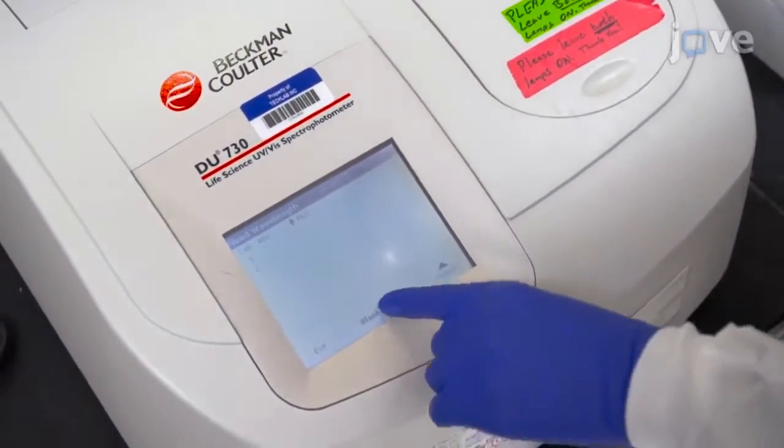Campylobacter culture is straightforward, but it requires quick and organized preparation to maintain quantitative viability. Considerable judgment is also needed to identify the campylobacter colonies amongst competing fecal flora on a plate.